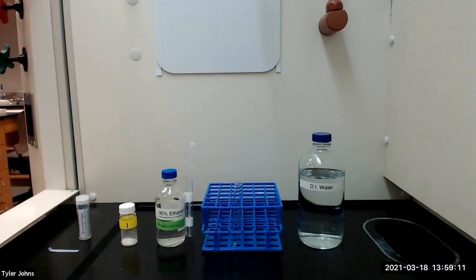We will next check the pH of an aqueous solution in which unknown number one has been dissolved.